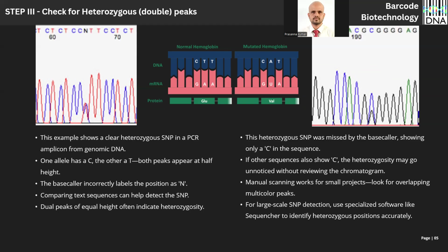Instead of the protein having the glutamic acid amino acid for its folding structure, it has valine, which created an entirely different structure that results in the disease. Okay. So what is this SNP, single nucleotide polymorphism? If you are inspecting the chromatogram, you can see here an unevenly spaced, oddly spaced peak. Okay, this peak, it's not a base, it's not noise. It's very clear they both are prominent peaks, right? Either they can be thymine or cytosine. So when you do not know how to call them, better call them an N. This is a perfect example of single nucleotide polymorphism.